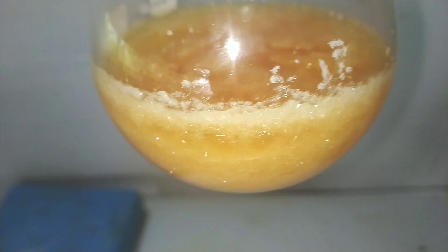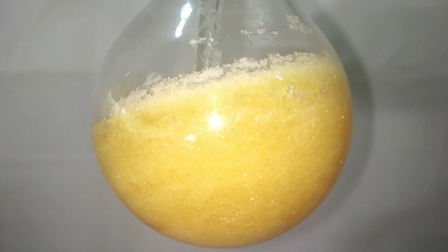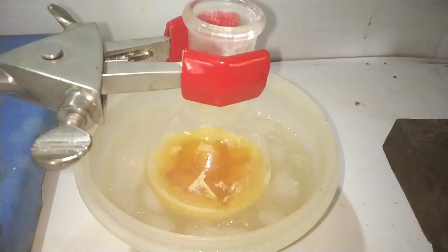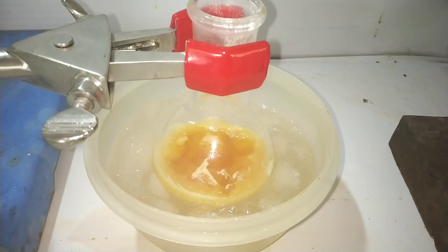After 90 minutes, take out the flask from the water bath and let it sit at room temperature to cool down slowly. This will cause more crystals to separate out. After cooling down to room temperature, we place the flask in an ice bath to completely crystallize out the crude product.